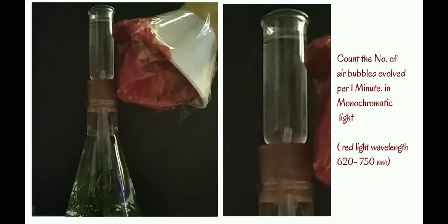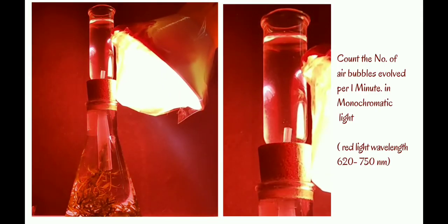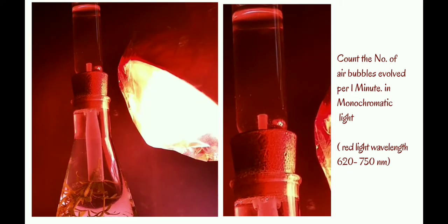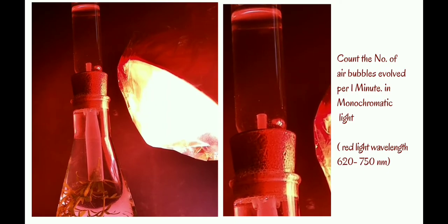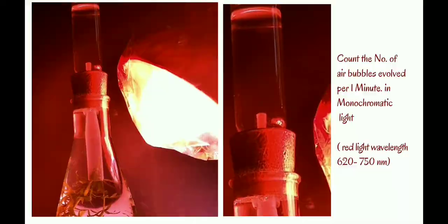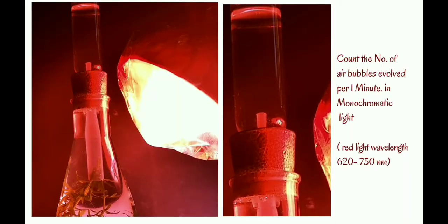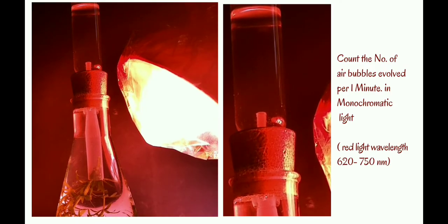The second setup is monochromatic light, red light wavelength of 620 to 750 nm. Here we count the number of air bubbles evolved per 1 minute. Observe and comment your answer in the comment session below.